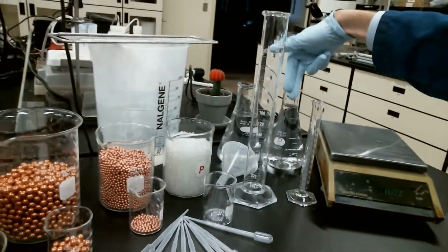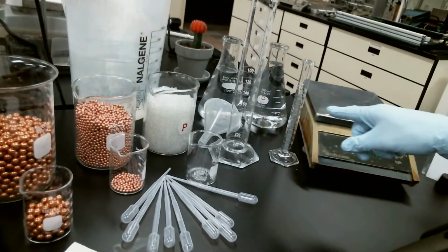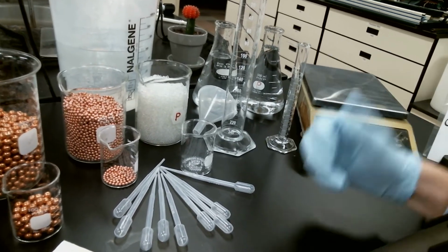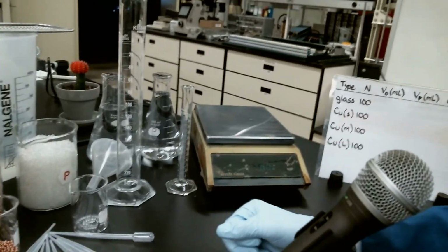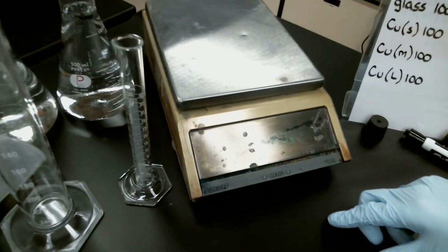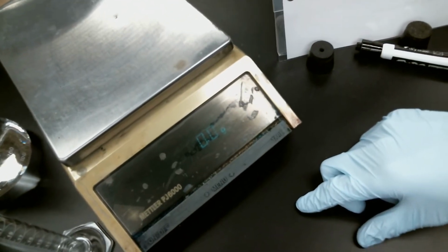So we know that there's going to be 100 of each of these that we're measuring. We've got a little bit of water back here in the back, so we can use that for whatever we need to, and a couple of graduated cylinders that are going to be our tool for measuring the volume of water displaced. And then we've got our friend the Mettler Toledo here, which if you can see around the glare, it's a little bit hard. There you go. It's got 1 digit of precision on it. That should be plenty for everything we're dealing with.